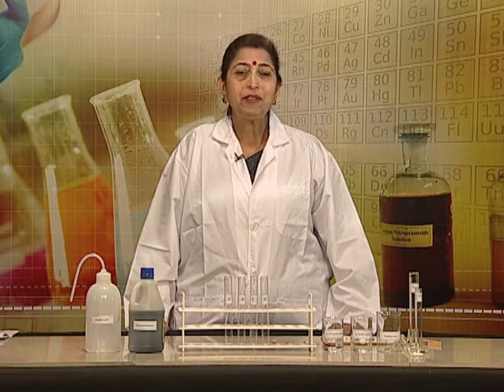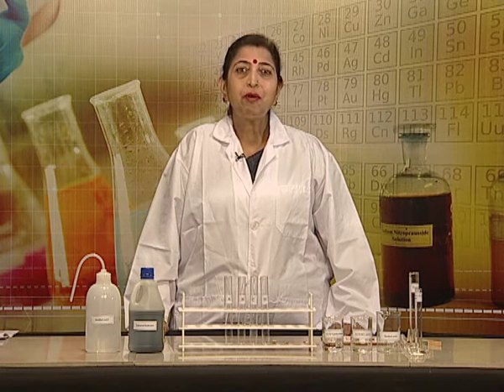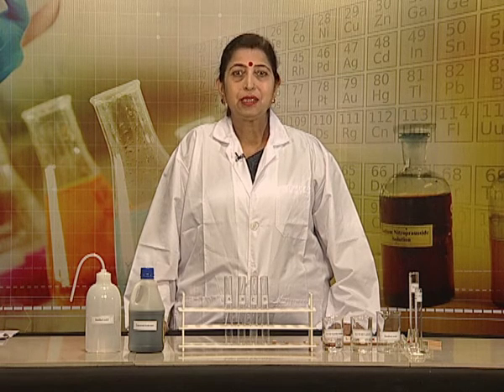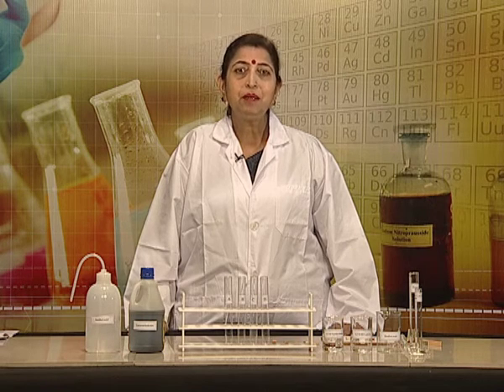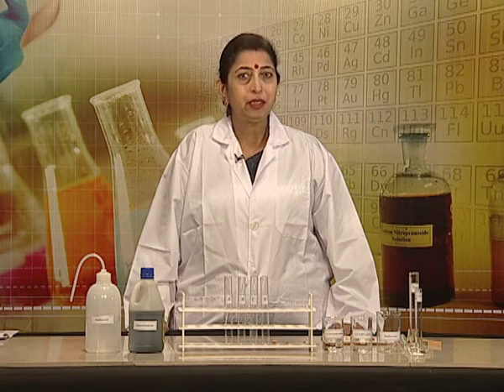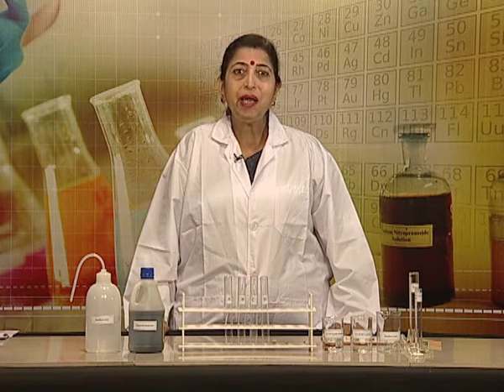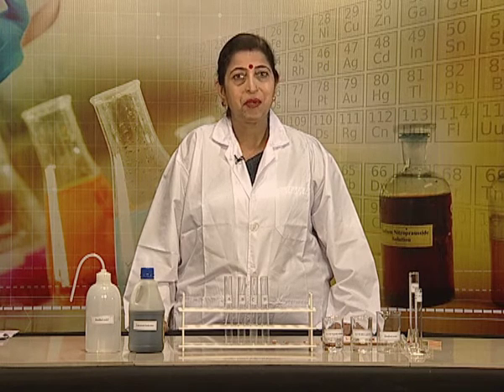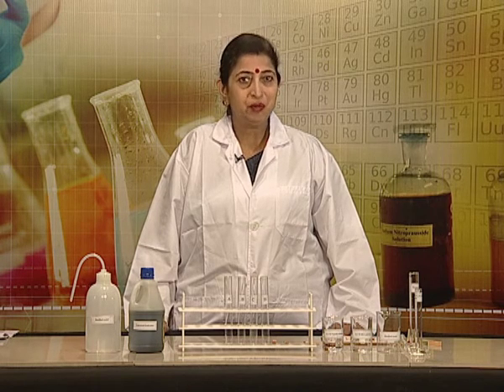pH value of a solution is the negative log of hydrogen ion concentration expressed in moles per liter. pH value is usually expressed at 25 degrees Celsius. So, here we start our experiment.